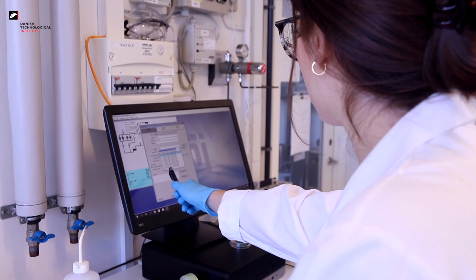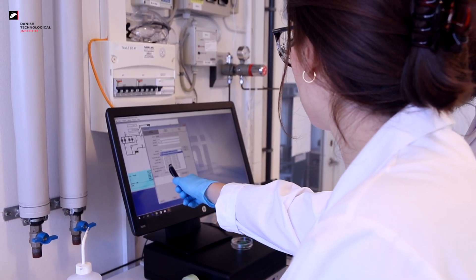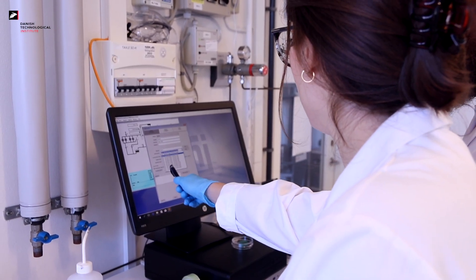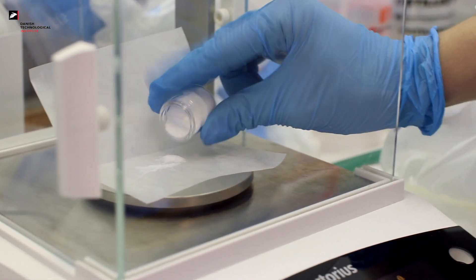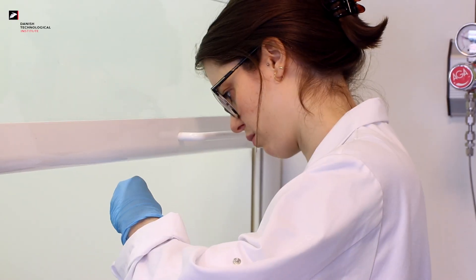Our mercury intrusion instrument is state-of-the-art, which means we can measure properties such as size distribution, volume, and surface area of the pores, as well as sample density.